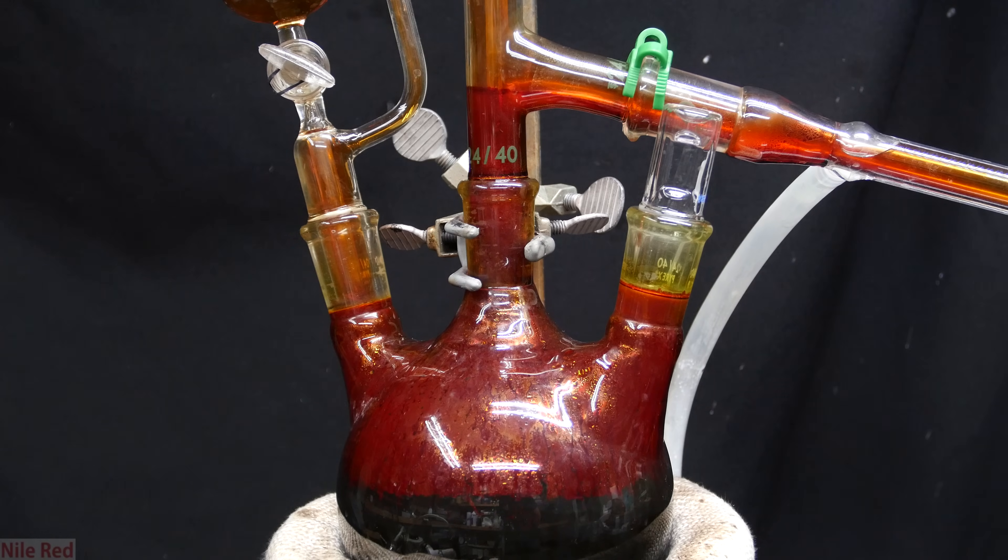At this point, you can see the dark red vapor front of bromine almost making it over. What's interesting is that at this point, we haven't used any external heating. All of the heat that's been provided is from the reaction itself.